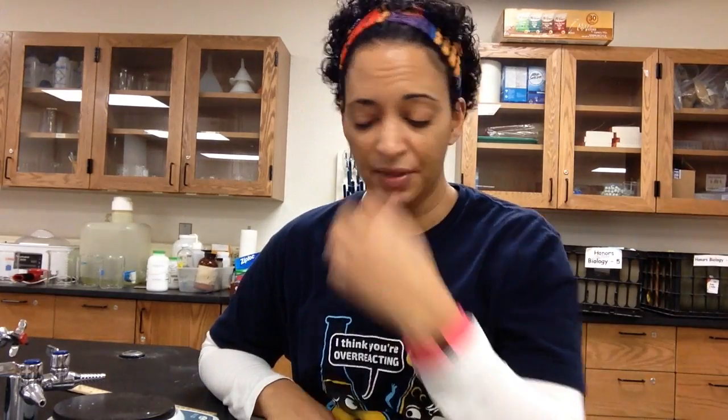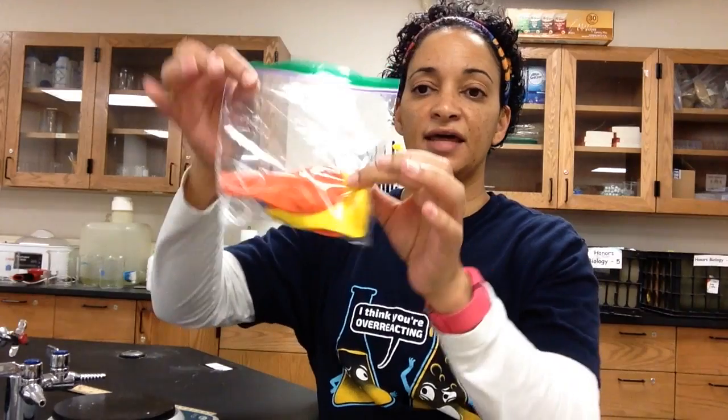Today we are going to be investigating which sugar yeast likes best. We'll know which one it likes best because that'll be the one that produces the most carbon dioxide. The sugars we're testing today are glucose, which is a monosaccharide; dextrose, which is also a monosaccharide; and we're also testing two disaccharides — lactose and sucrose.